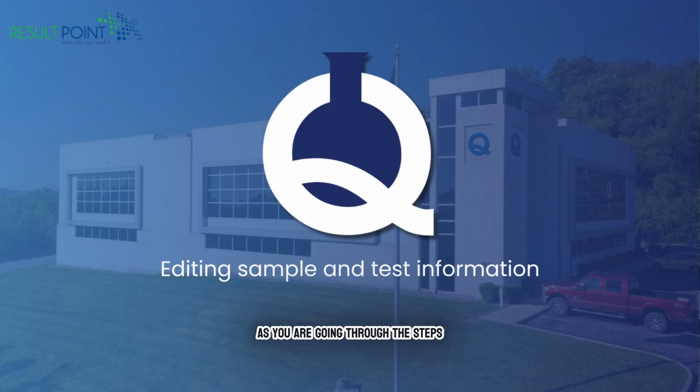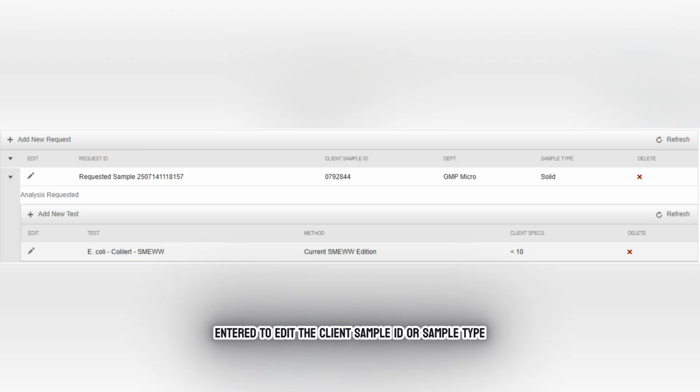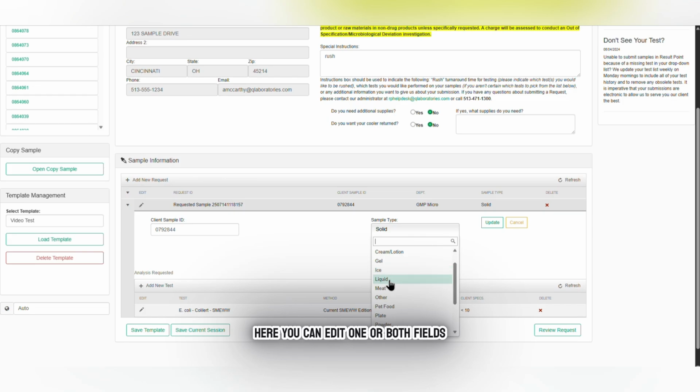As you are going through the steps outlined in the previous section, you may need to make a change to the sample information entered. To edit the client sample ID or sample type, click the small pencil icon to the left of the sample you are changing. A new row will appear underneath the original sample information. Here you can edit one or both fields. After you have finished making changes, click the Update button on the right.